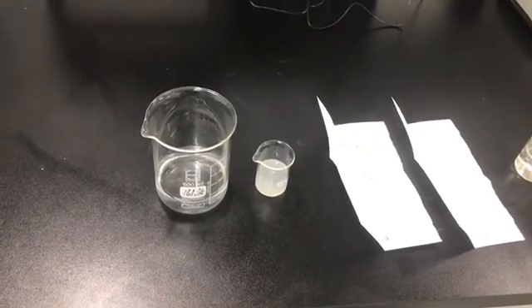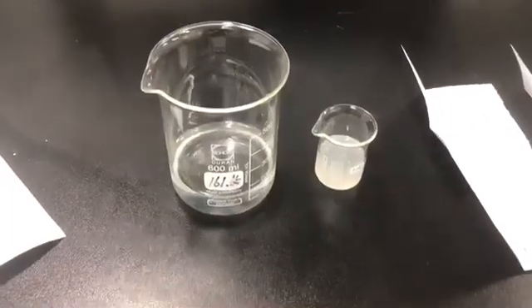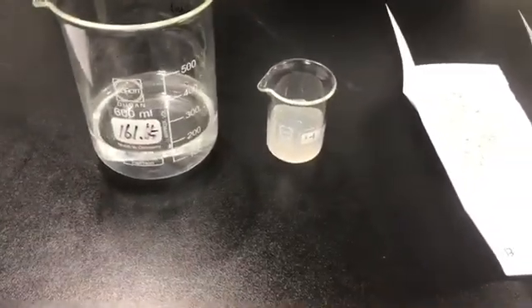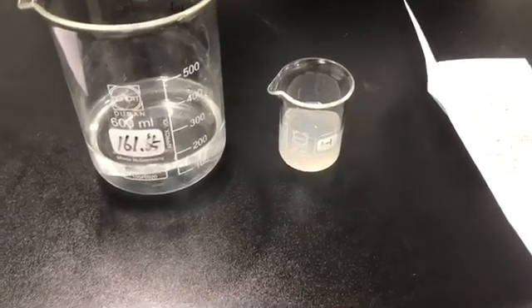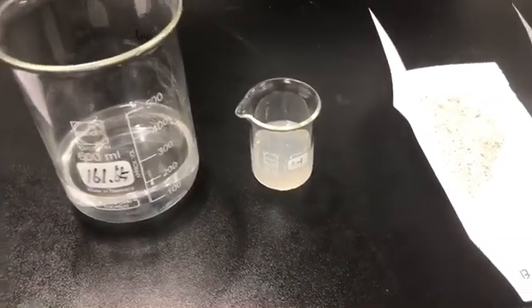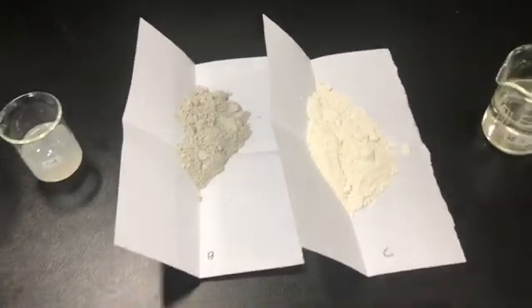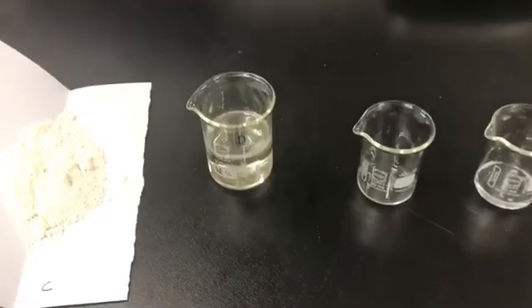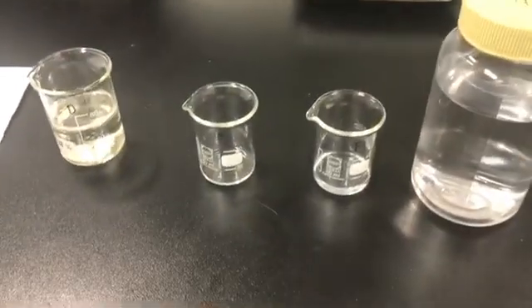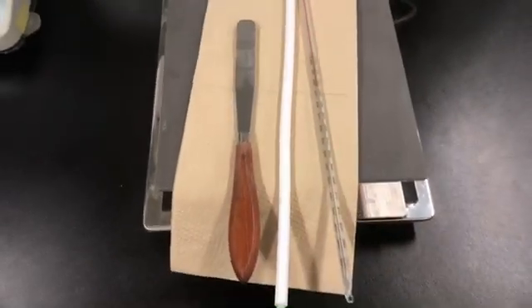Hello, this is a guide for formulation of bubble pack. This is phase A, and this one is phase A-1. For the A-1 phase, we made a 2% solution for easy use in advance. Then phases B, C, D, E, F, and G. We are going to use a homo mixer, a thermometer, and two spatulas.